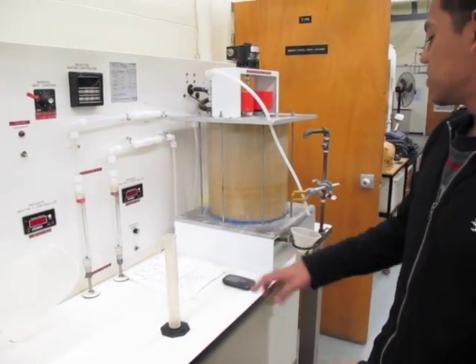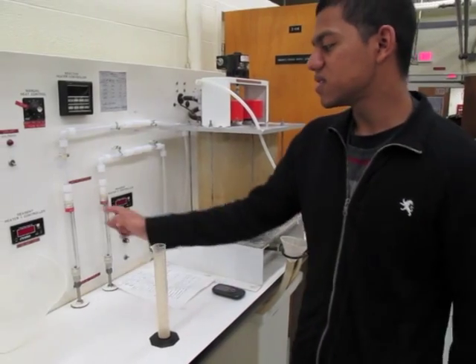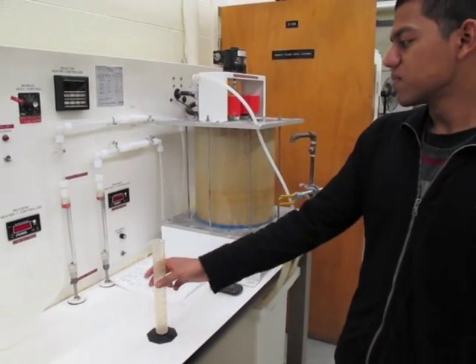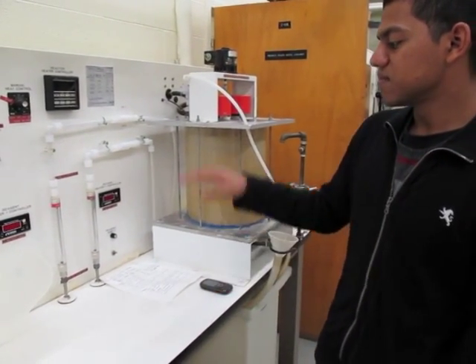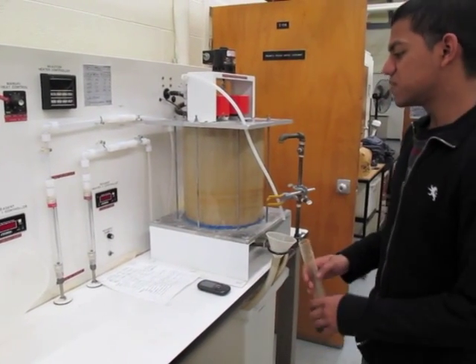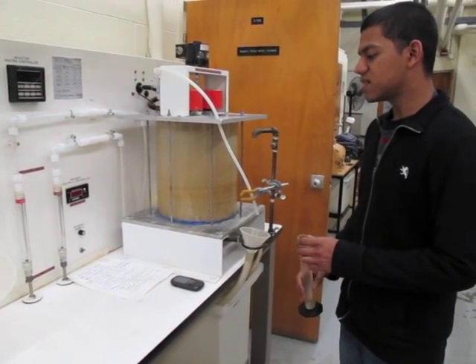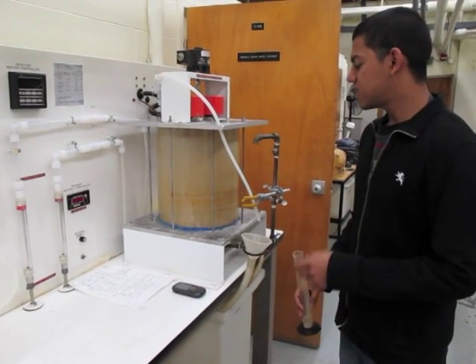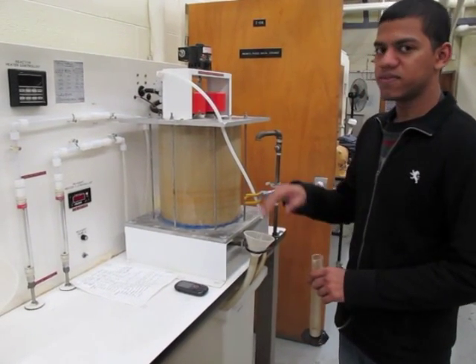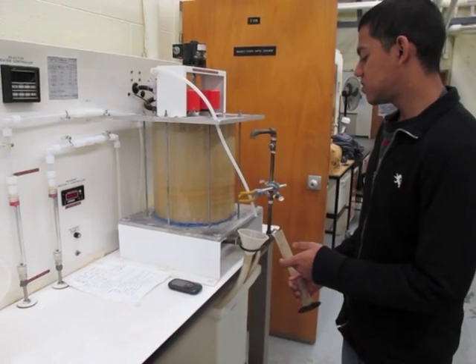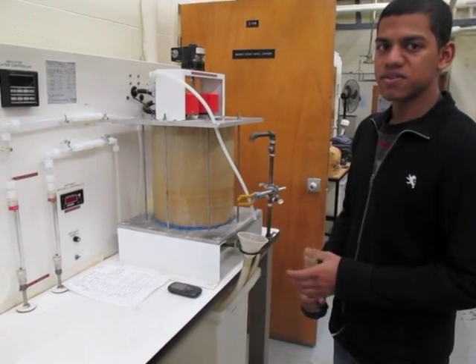For the second pump, you want to redo the same experiment, but make sure that the first pump is off. You want to change to different percent flows. For 20%, you might want to use one minute, and for when you get to 50%, you might have to get a volume sample of half a minute.